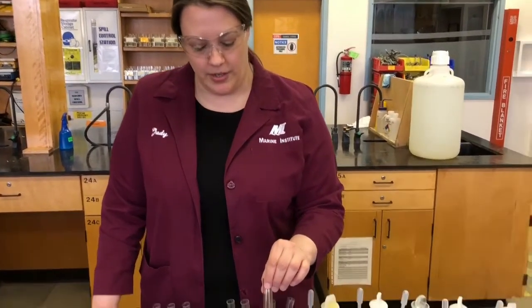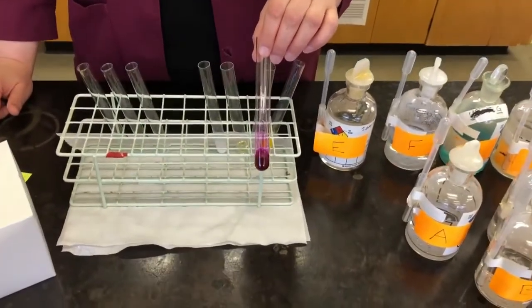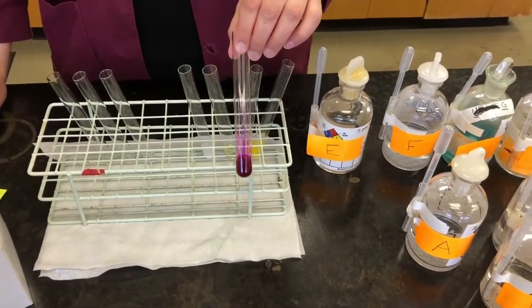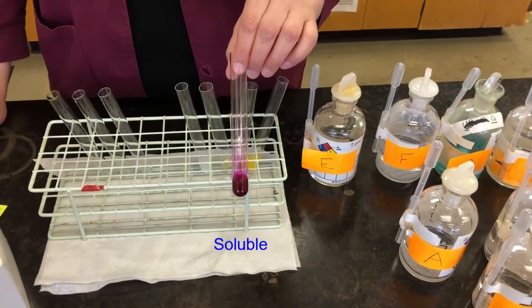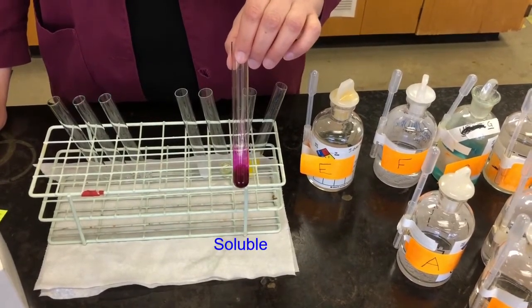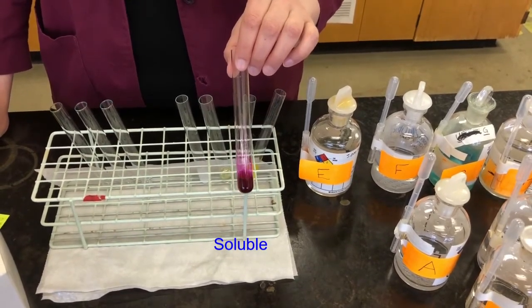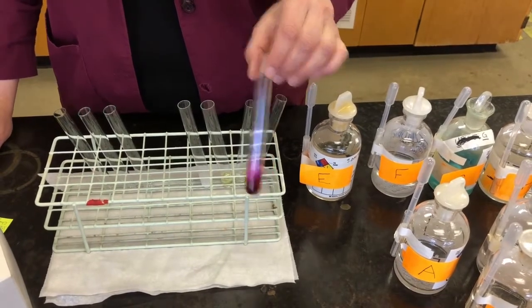So my observations are that we have a color change, we have a red color being formed, and an odor being produced. My deduction is going to be that E and F reacted to produce a reddish purple product that is soluble in water. So there's no precipitate, there's no solid being formed there. So that product, whatever that red product is, or that purple product, is soluble in the water. Okay. So that's our deductions on that one.